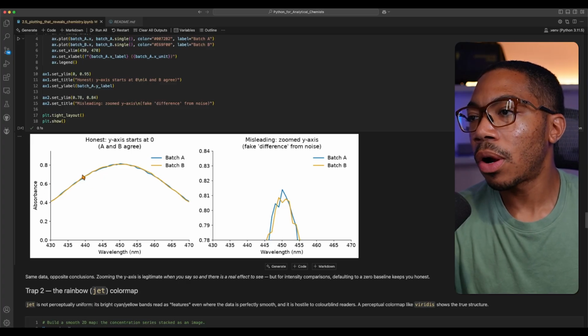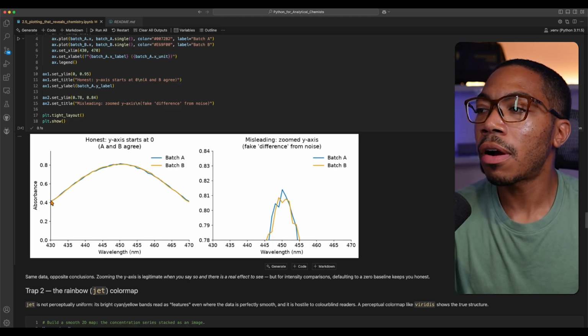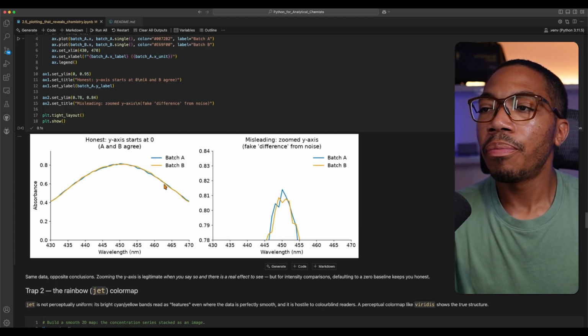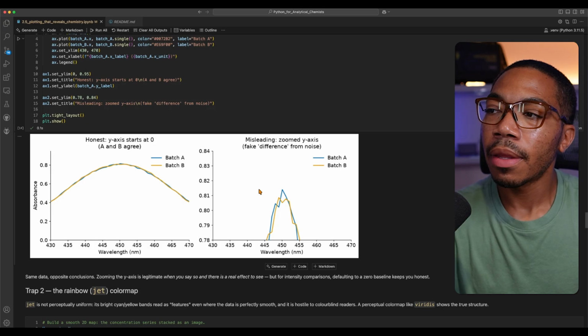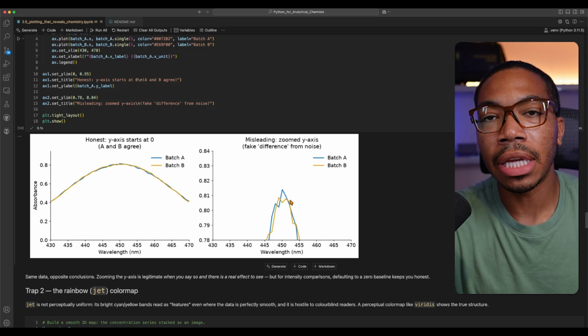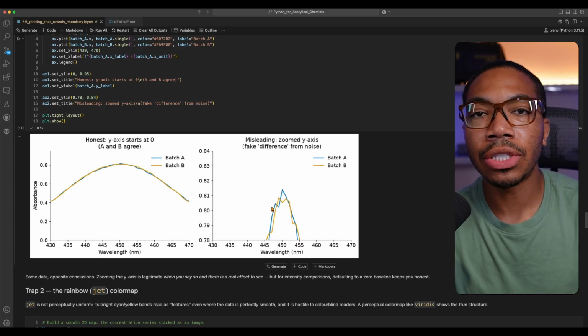Lastly, let's focus on some misleading visualizations. And the first topic will be zooming in too far. Now I'm going to show you two plots here, where on the left we have what I'm going to call an honest plot, where we're zoomed out pretty far. We see that batch A and batch B both have this curvature here. But now let's zoom in really close. Notice our y-axis is now 0.78 to 0.84, which would be something in this region here. And now this is truly just looking at noise. This is not a meaningful zoom and could lead to misleading interpretations of this data.